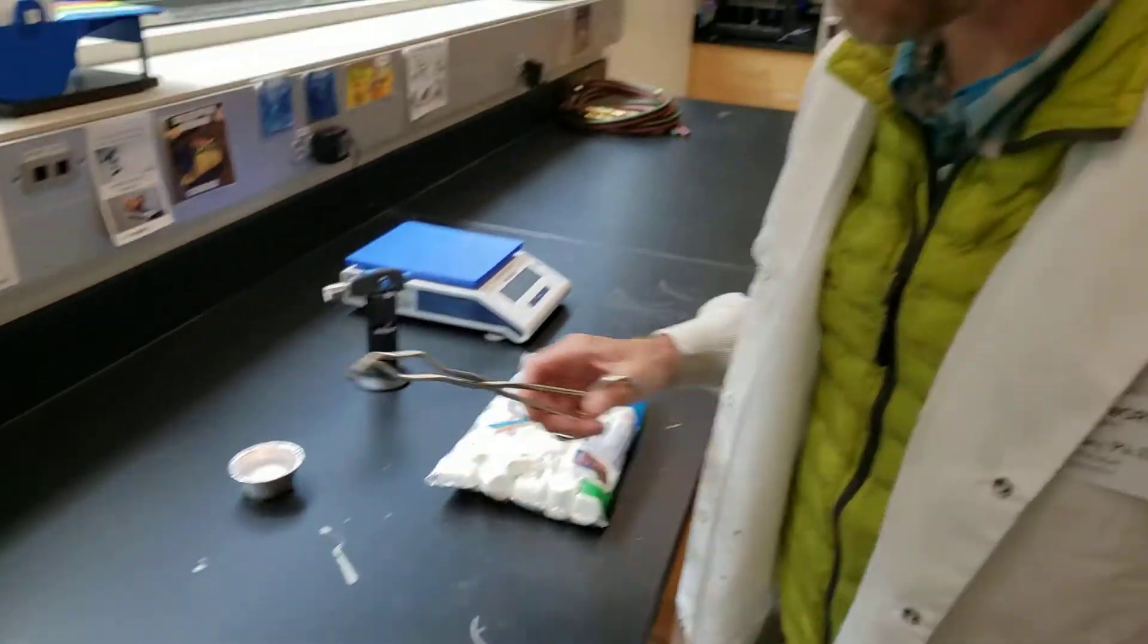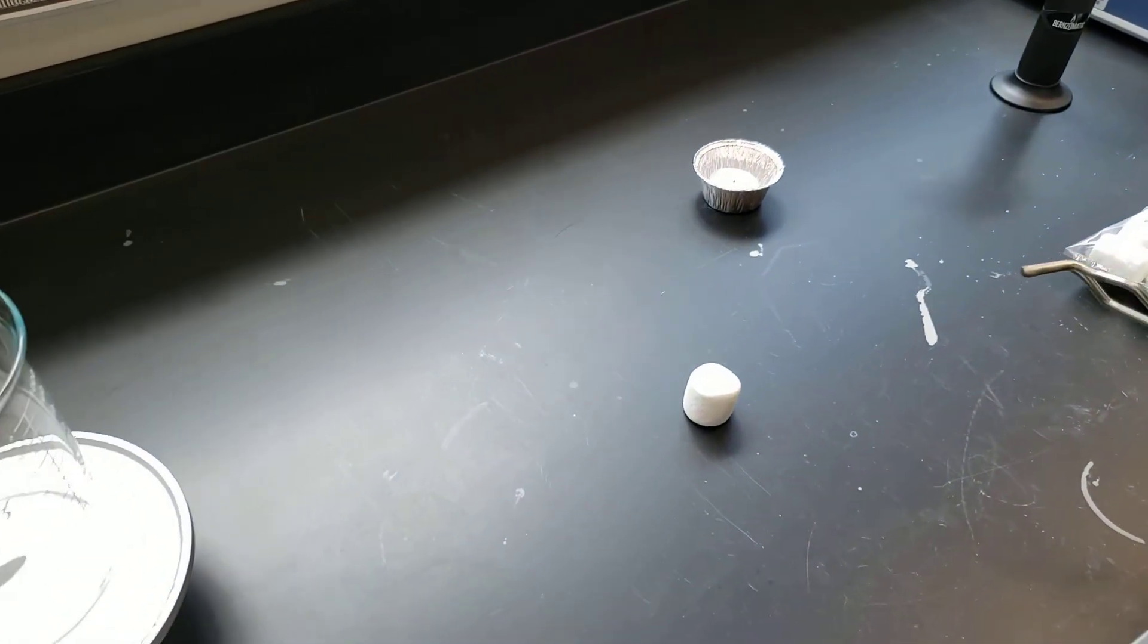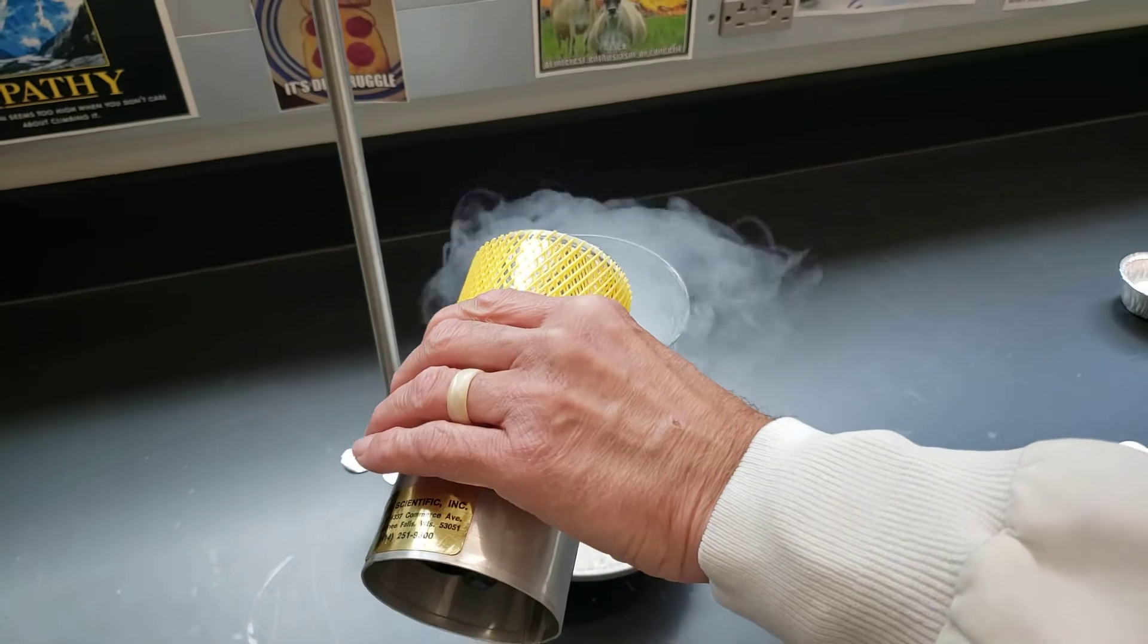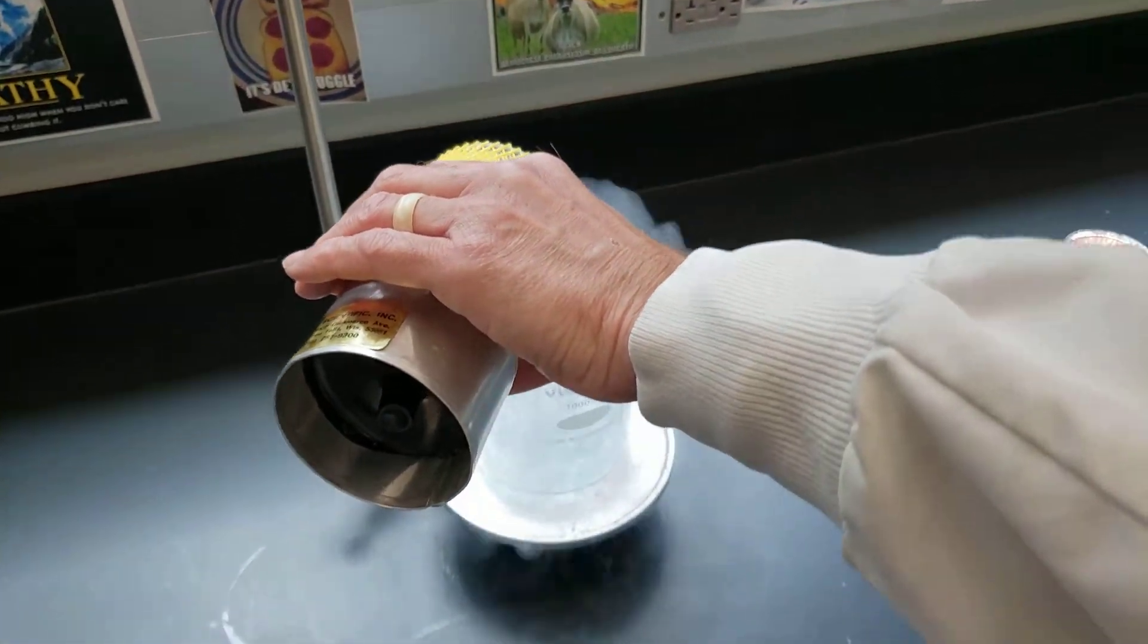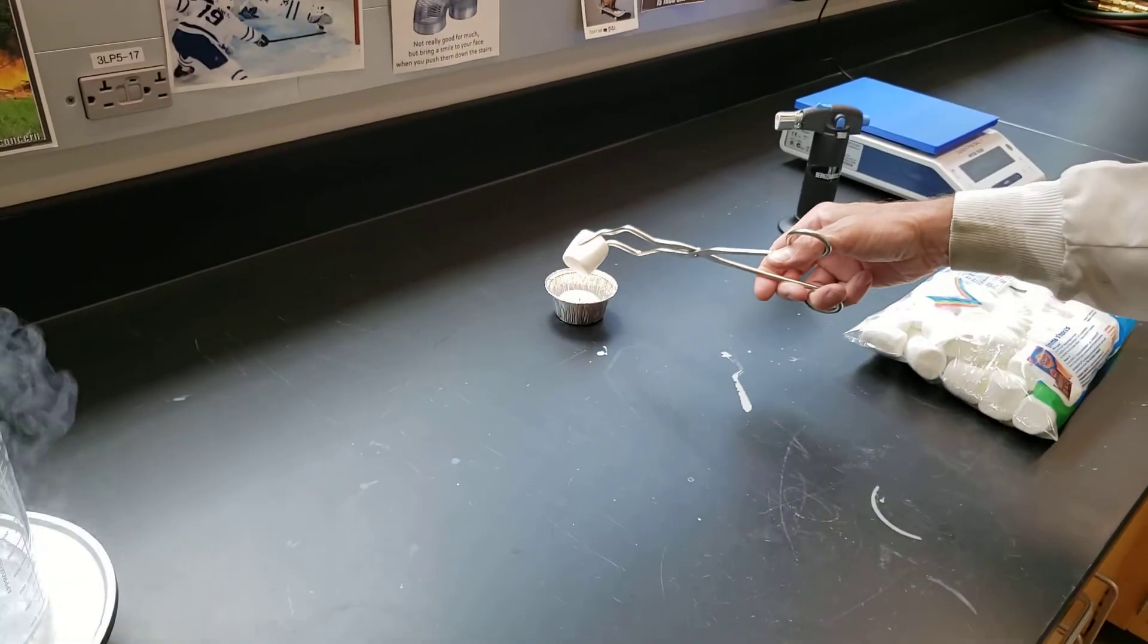So you all know burning a marshmallow in a campfire it gets all kind of carbony but here in the liquid oxygen it's going to be complete combustion which will be really cool. So let's see if we can start this guy on fire.